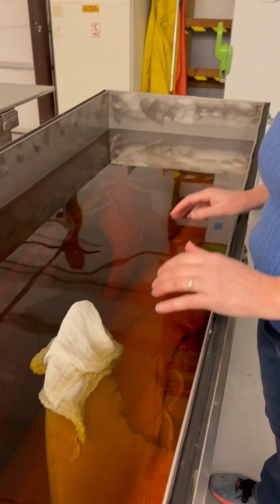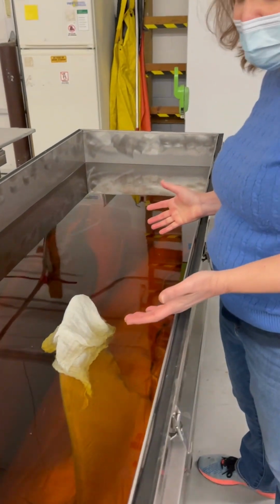The ethanol in here is discolored, and it also has this oil slick that you can kind of see on the top. And that's something that happens a lot with shark specimens. So sharks are really fatty and oily.